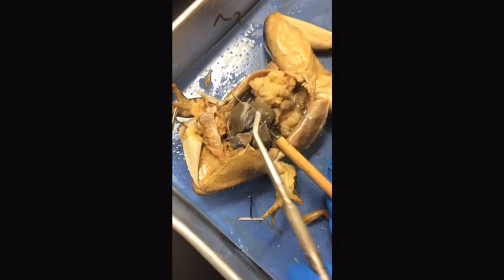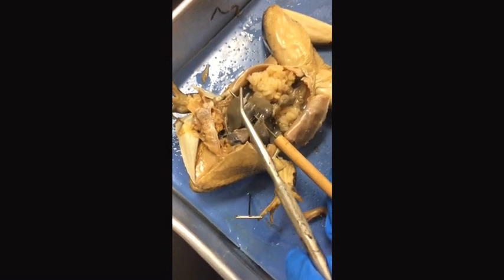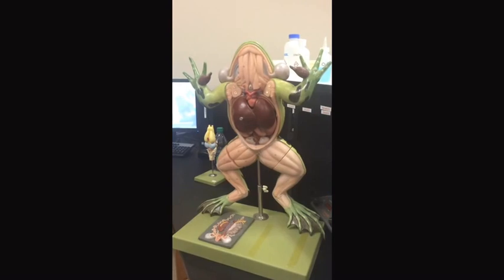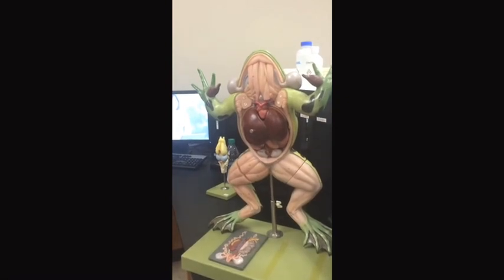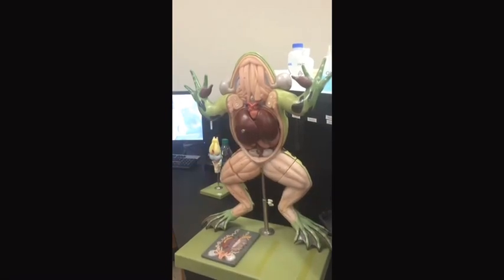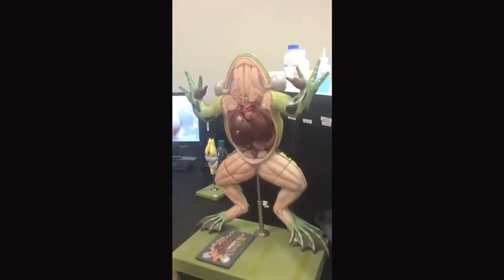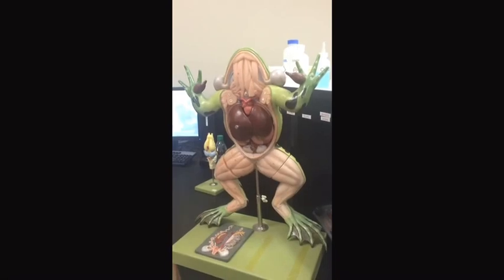Here are the lungs — this one and this one. They are used in respiration. The frog can also respirate through its skin, picking up oxygen through capillaries. Amphibians ventilate their lungs with positive pressure breathing, as opposed to negative pressure breathing in mammals. The frog inflates the lungs with forced airflow: fresh air is drawn through the nostrils into the oral cavity, stale air is forced out, and then with nostrils and mouth closed, the floor of the oral cavity moves upward, forcing air into the lungs.